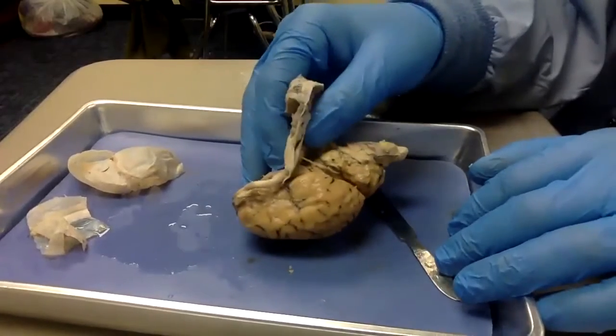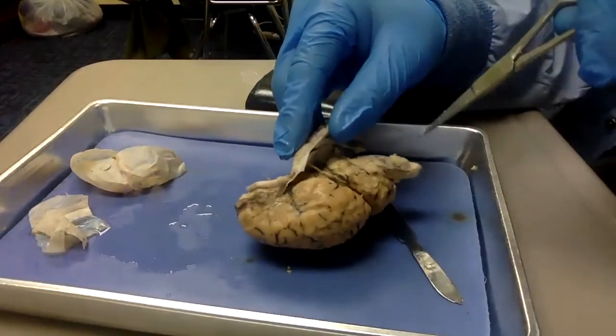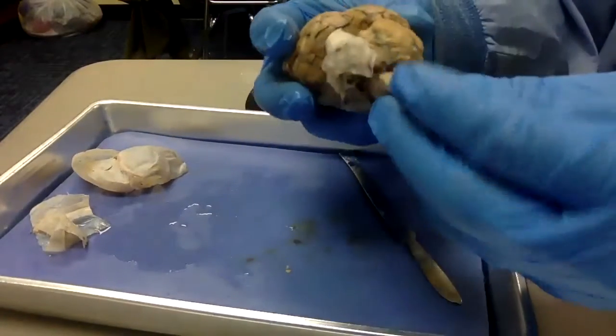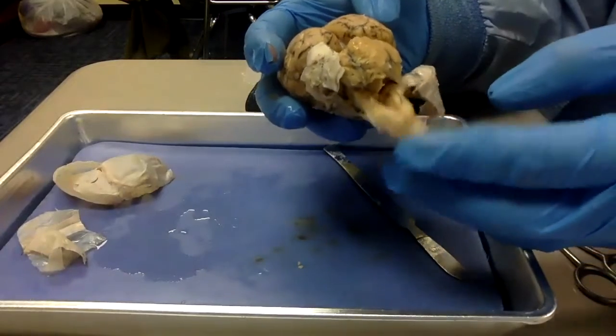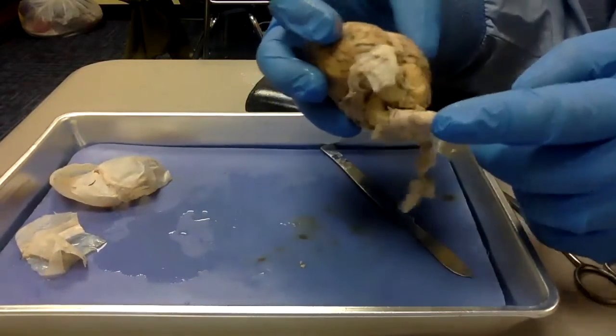First off, you'll notice that I made a bit of a mistake because I'm trying to work at a weird angle so you can see. Normally I would be cutting like this, right? But I accidentally ripped a bit of the brainstem off. So, oops, but it's fine. You see right here where it's supposed to be. So it falls off later.